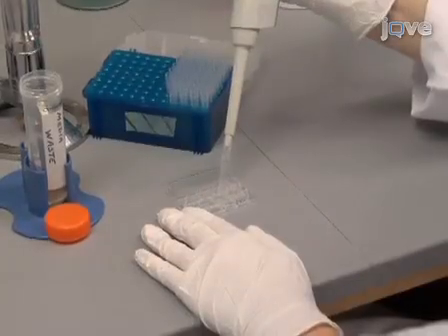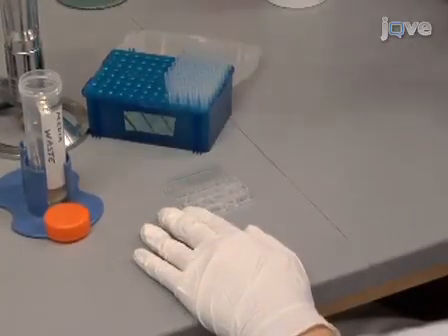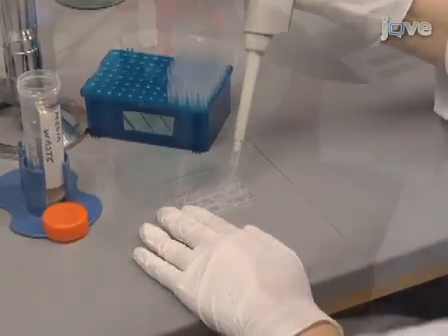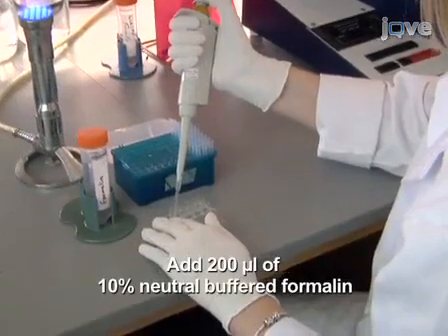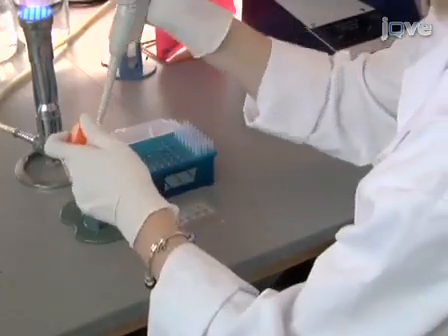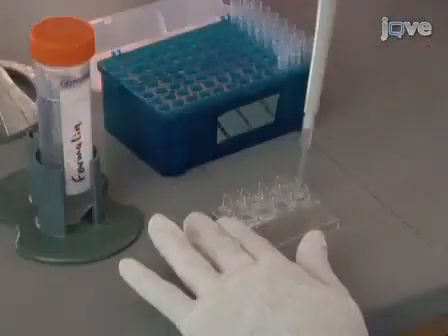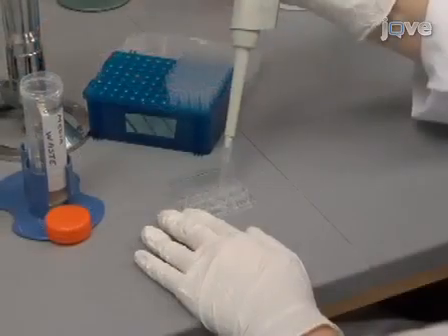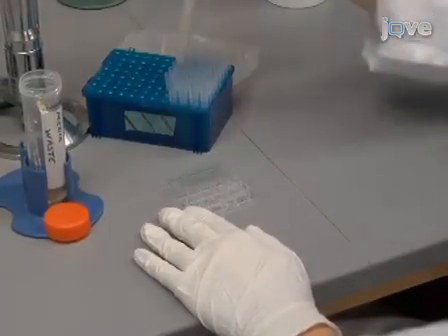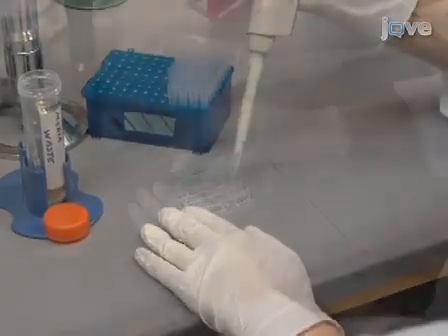Once the cells have been stained, remove the live/dead stain and wash each well twice with saline as demonstrated earlier. Add 200 microliters of neutral buffered formalin to each well and incubate the slide at room temperature for at least 30 minutes to fix the specimen. Following this incubation, remove and discard the fixative and wash the biofilms twice using saline.